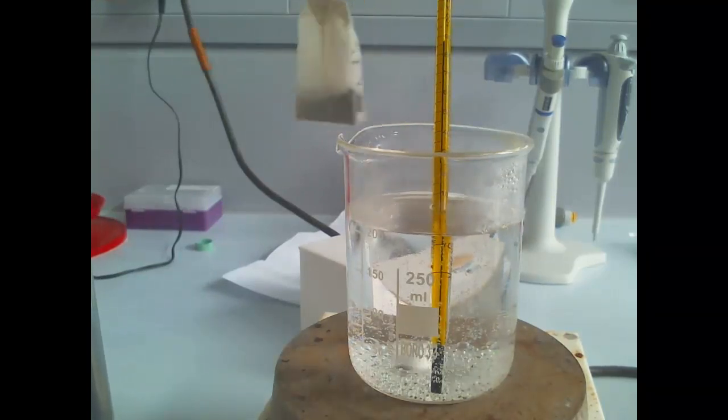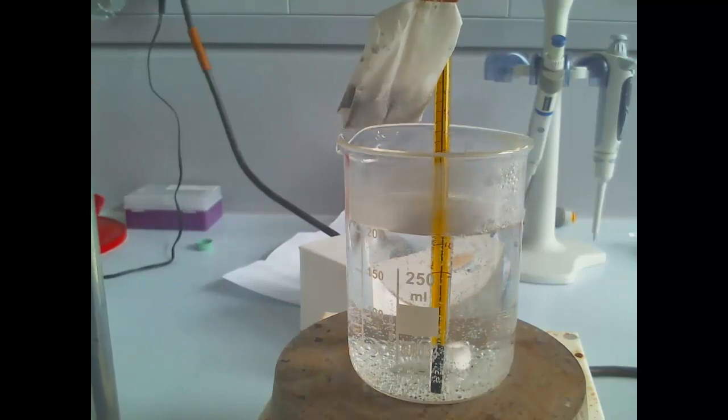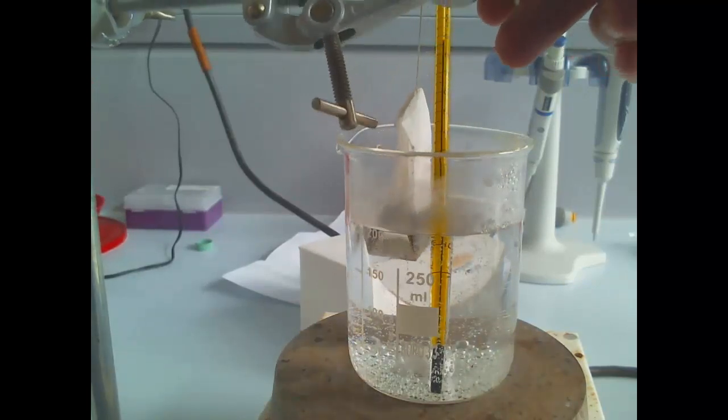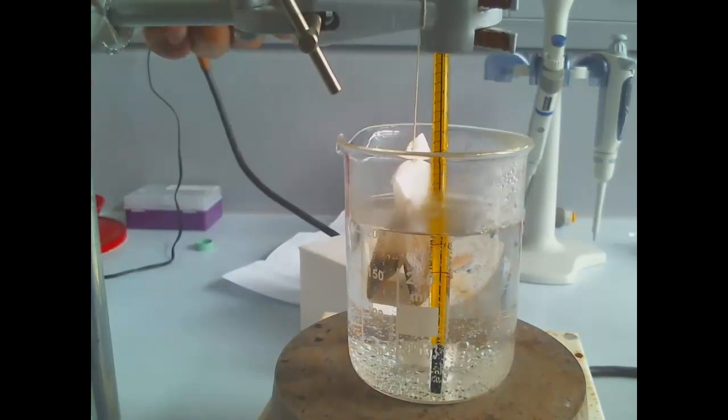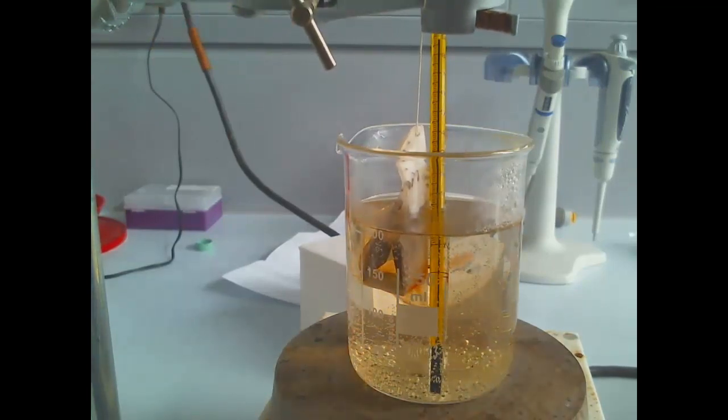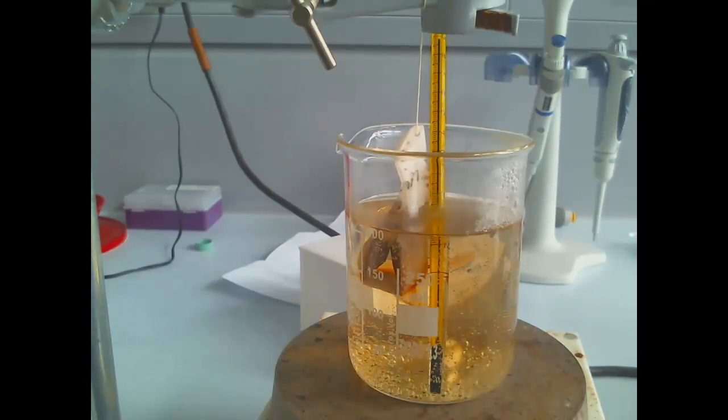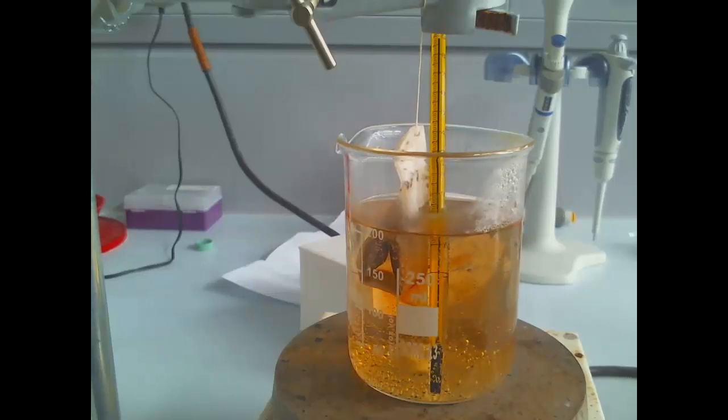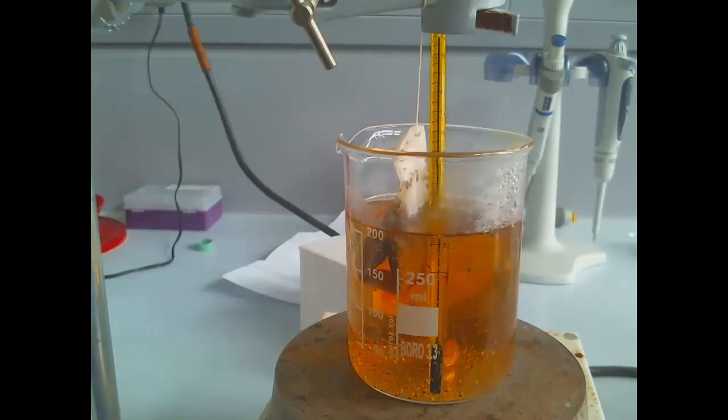So I've tried to record video audio for this several times. So this is me making tea. Using a tea bag this time to slow down the extraction, because when we added leaves it came out far too fast and it wasn't realistically like a normal tea making process. So this is a tea bag with a stirrer. The stirrer is to make it more reproducible and also to mix up the tea coming out so that we can take samples over time. It's 200 milliliters and one tea bag which ends up with quite weak tea. We could make it a bit stronger. At this sample it's sort of similar to how Germans tend to drink it. It's a bit weak for English people or Turkish people for example. So we could make it twice as concentrated for example. That wouldn't hurt.